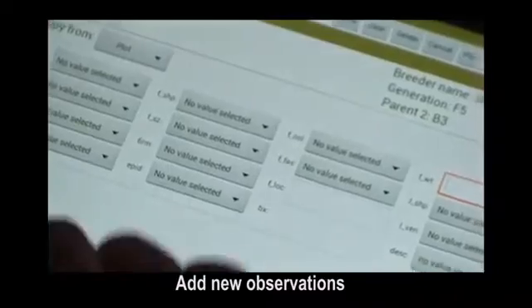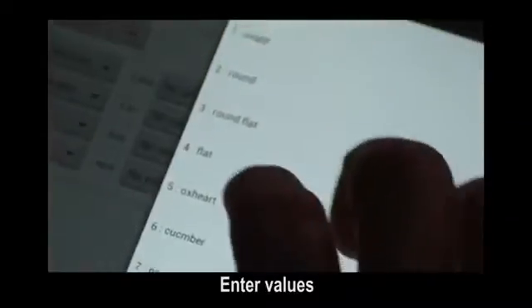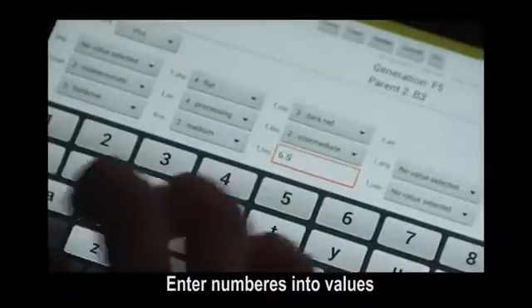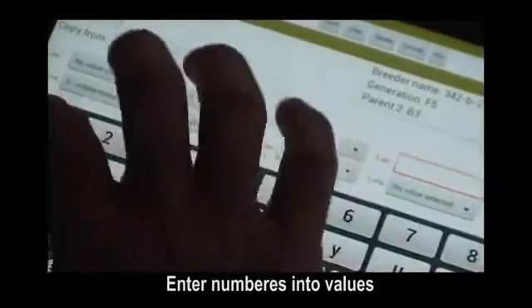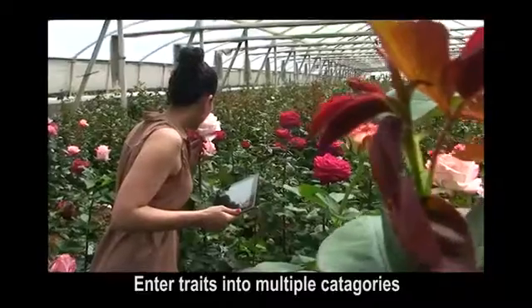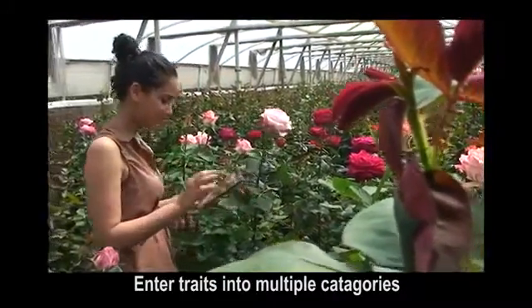To enter a new observation, select a value. Select the empty box to enter number values. Enter traits by selecting multiple categories.